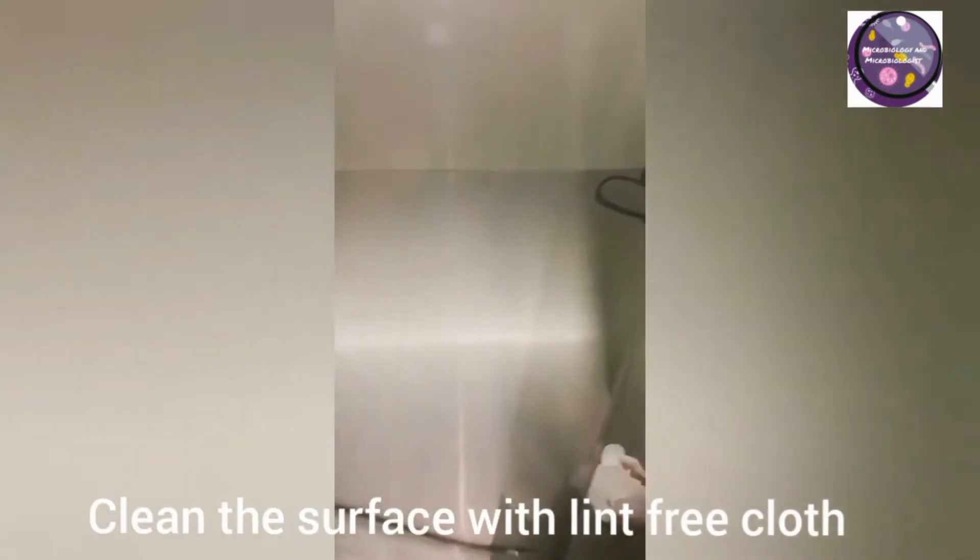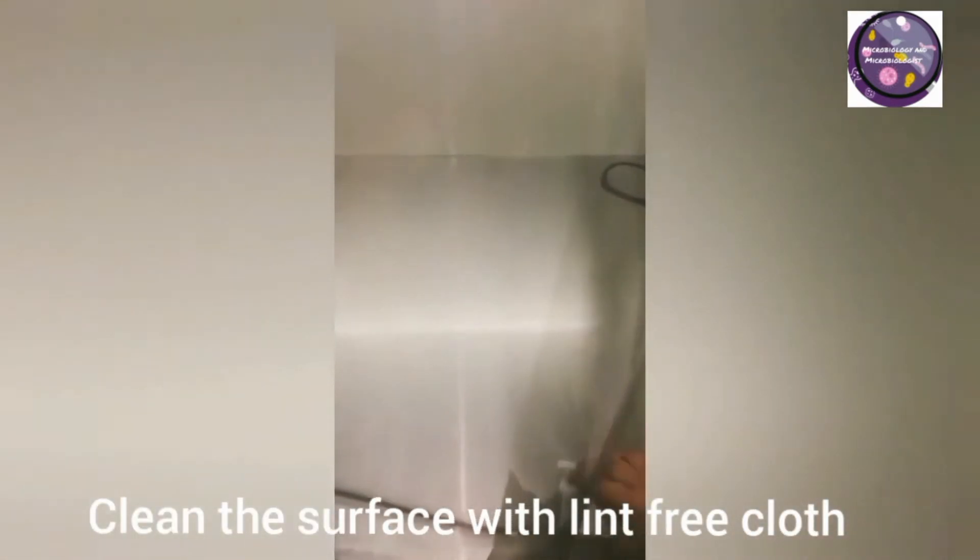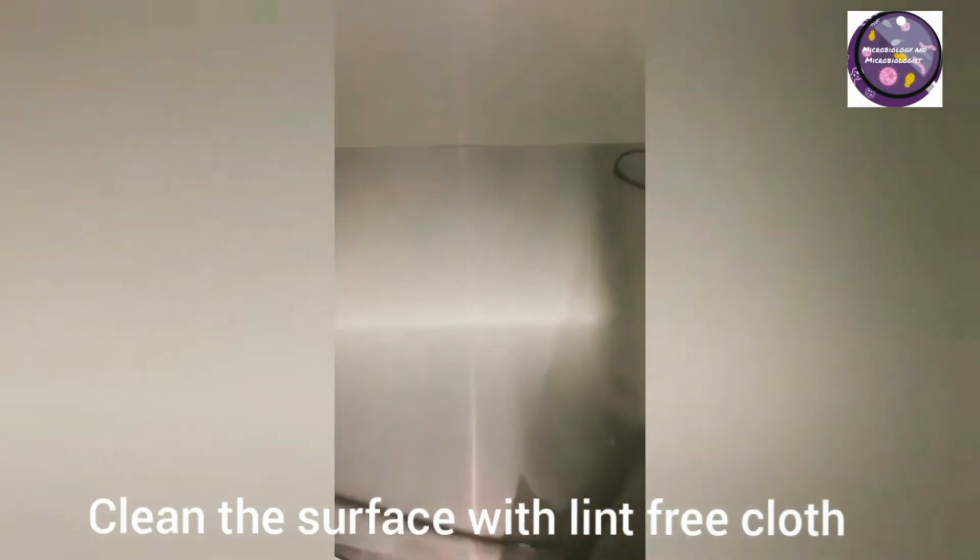After applying the disinfectant, I'm using absorbable tissue to clean and soak the surface. We can also use lint-free cloth.